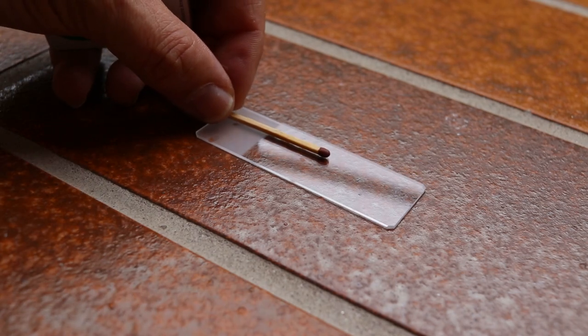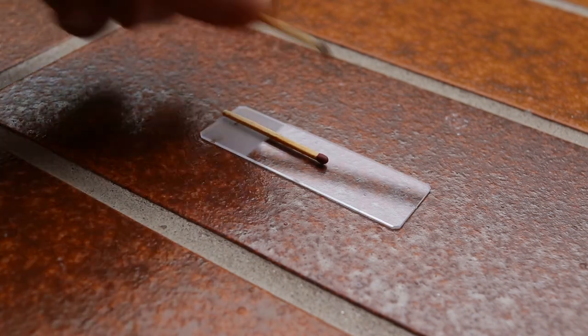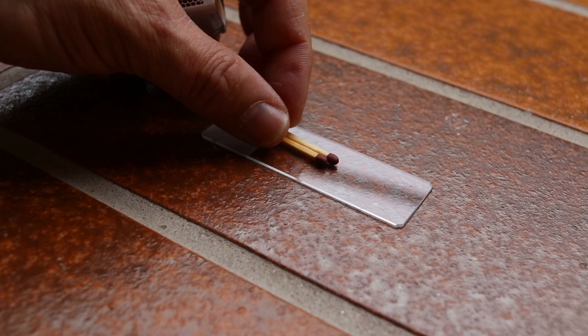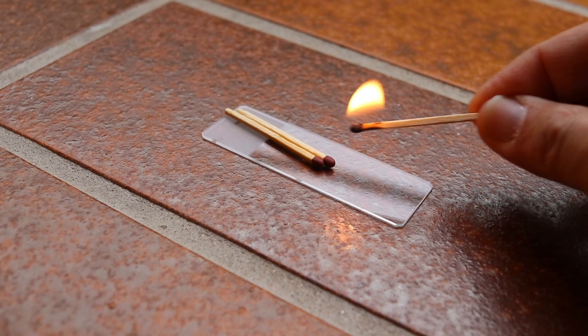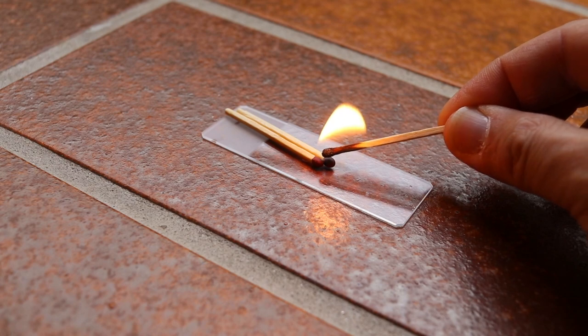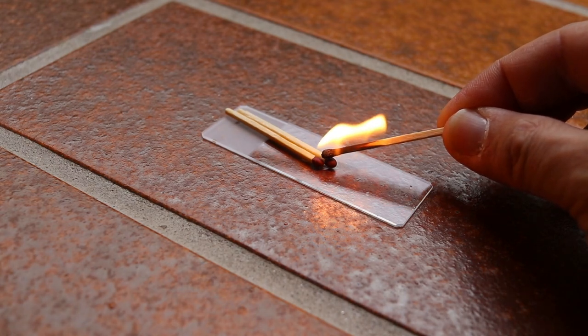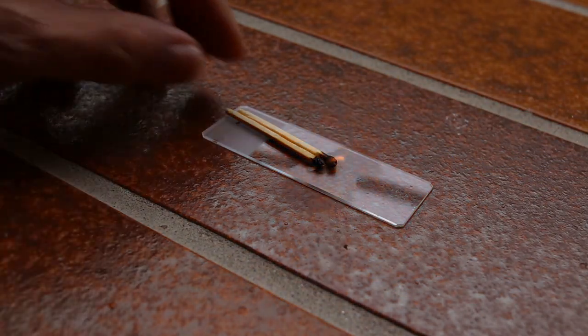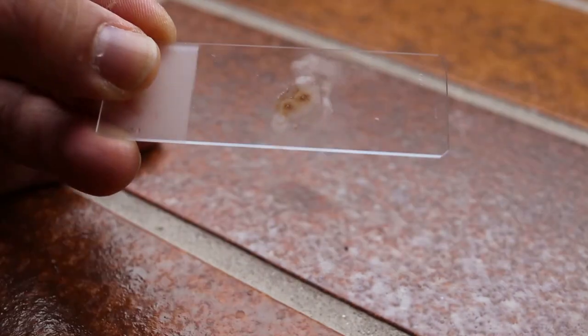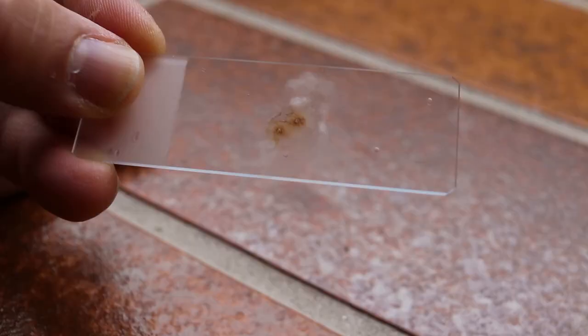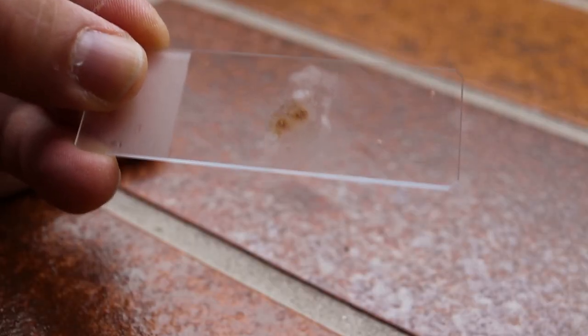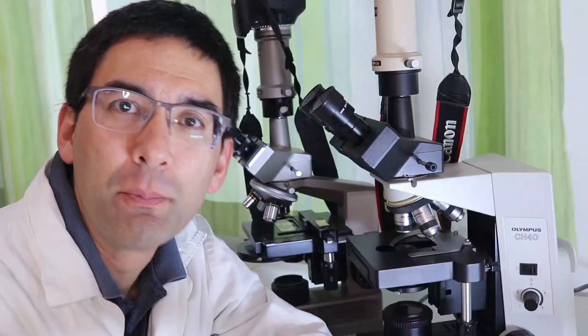It does go without saying that you do need a safe and a fireproof surface to work on. And what I'm going to do is I'm going to light these two matches to burn the heads off. This sounds horrible, but actually you get the point what I want to do here. You see a lot of residue and these are the sulfur crystals and I'm going to look at them.